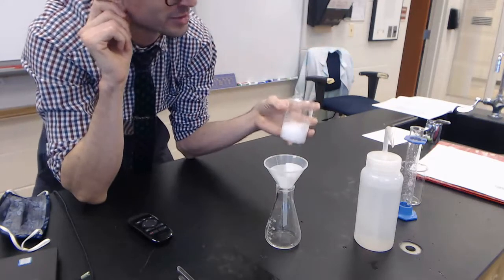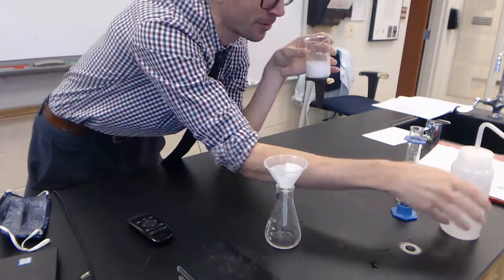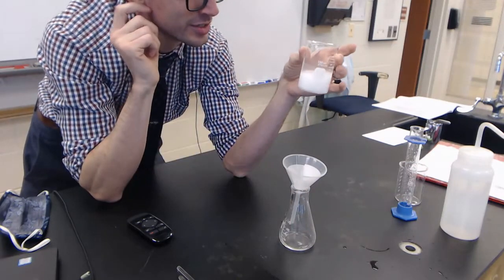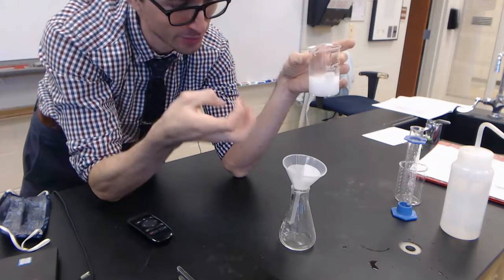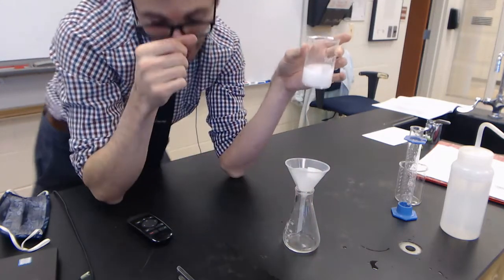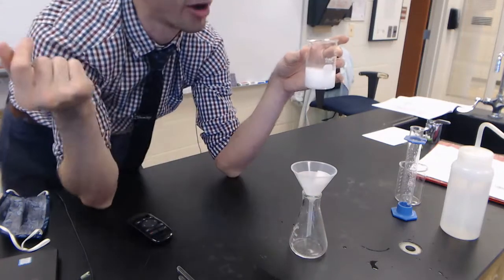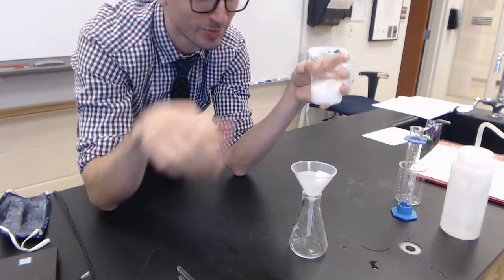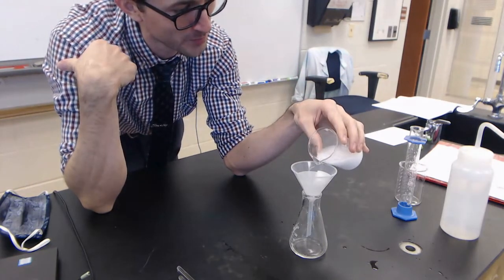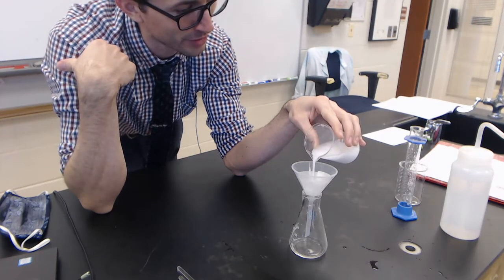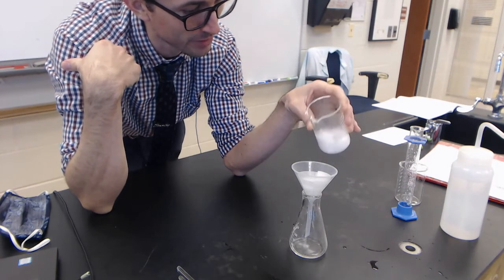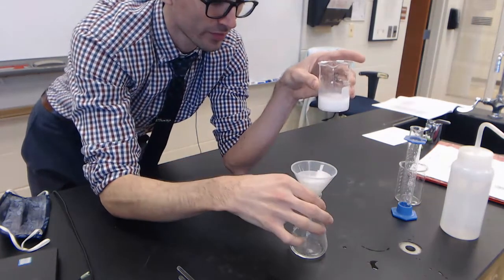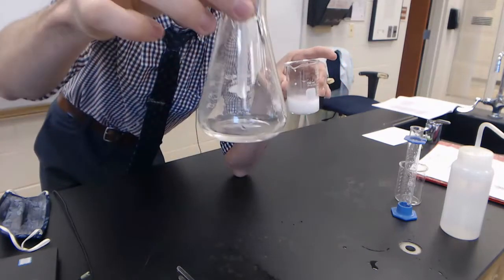This is the most exciting part of the experiment. It's like making coffee. All you do is put the mixture in the filter and the coffee machine is already turned on. We just have to wait until everything goes through. We can't rush. You can't make coffee in 30 seconds at home. Same thing here. I'm going to slowly pour some of my mixture in the funnel filter paper.